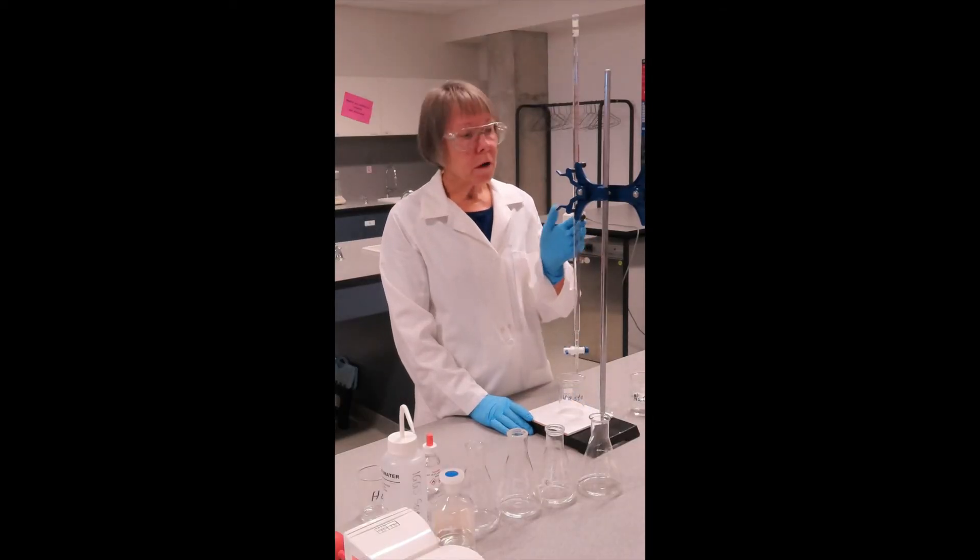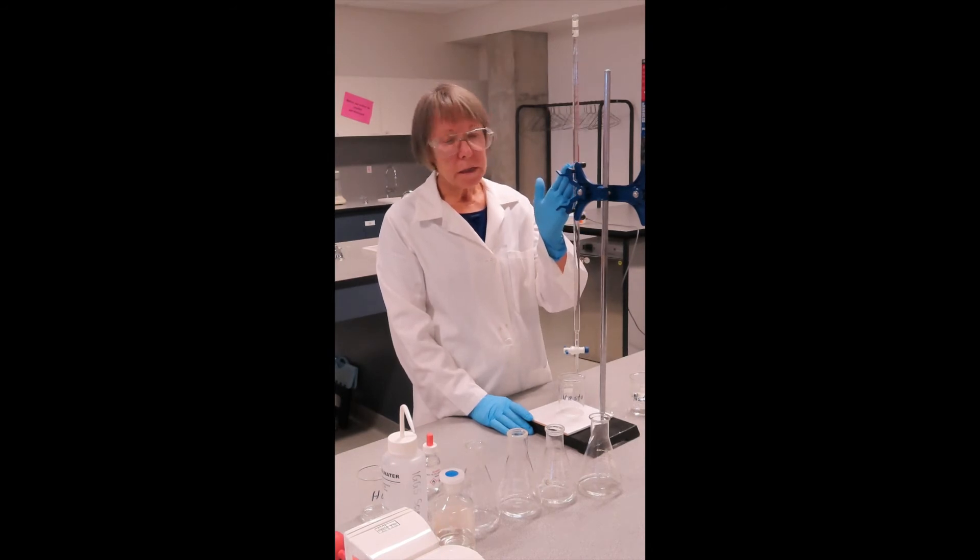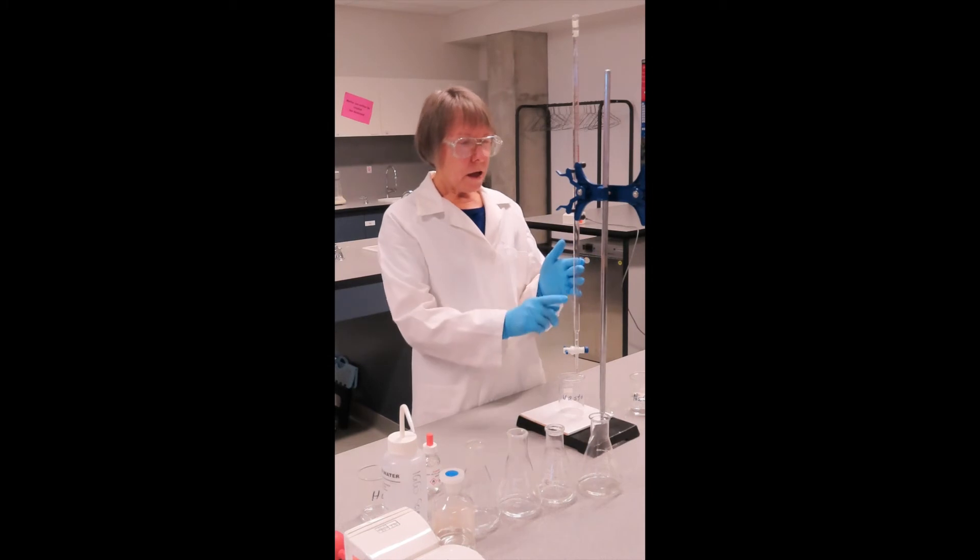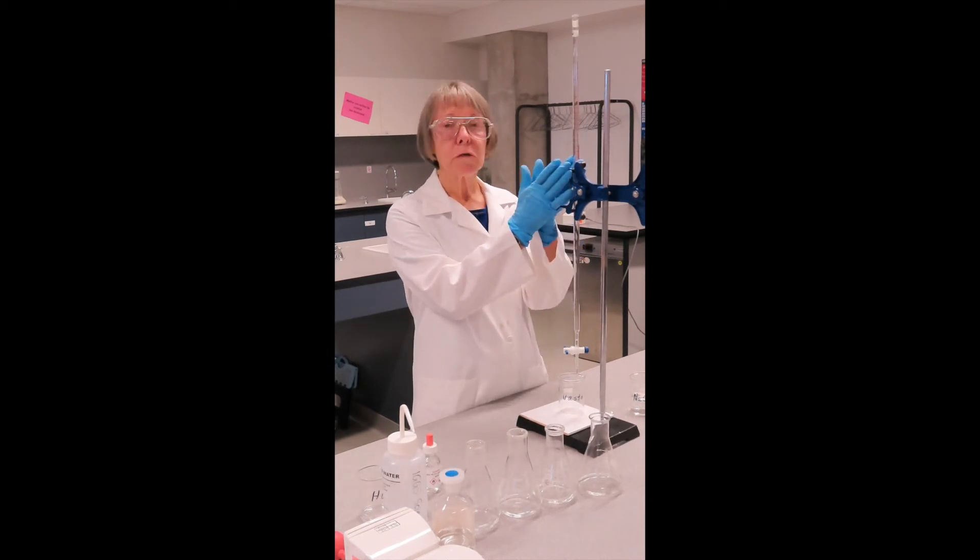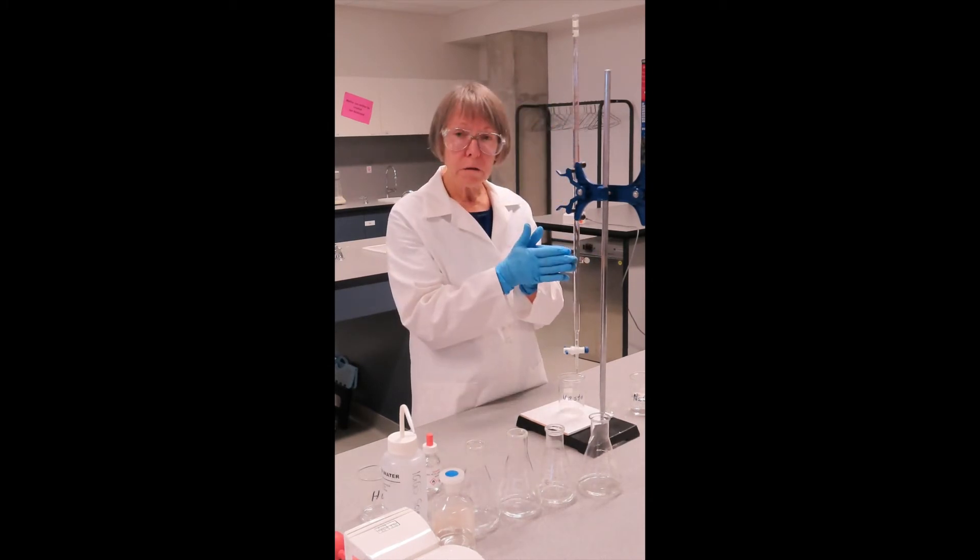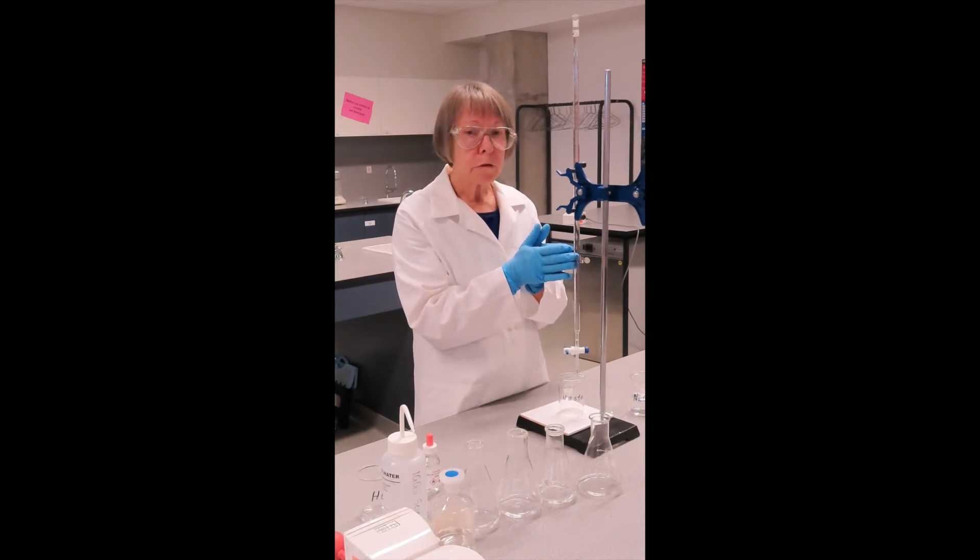I have now finished rinsing my burette, and I have placed it in a burette clamp attached to a retort stand. In setting it up, I've had to make sure that it is actually vertical, because we don't want to introduce any parallax error when we come to reading the burette.